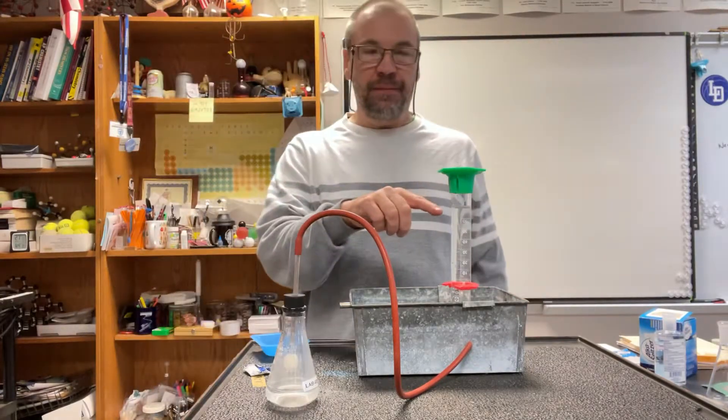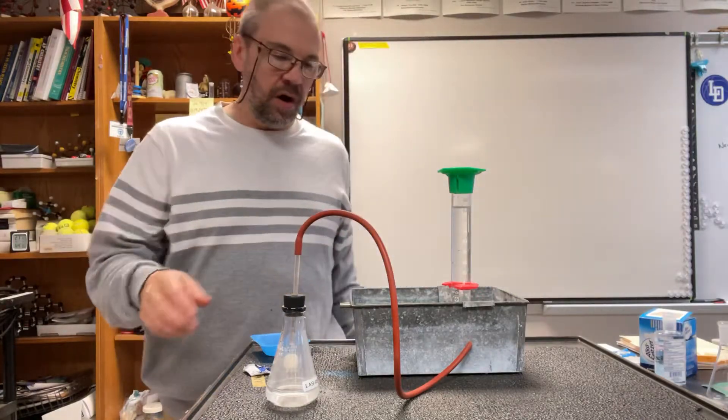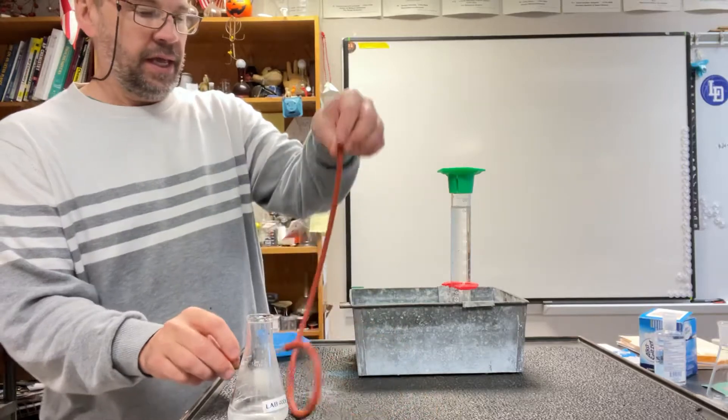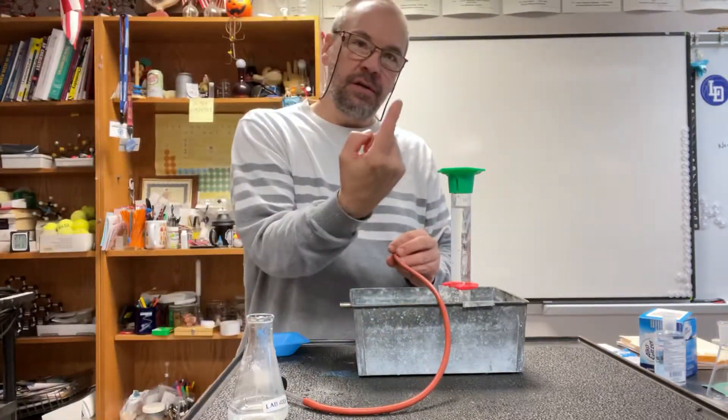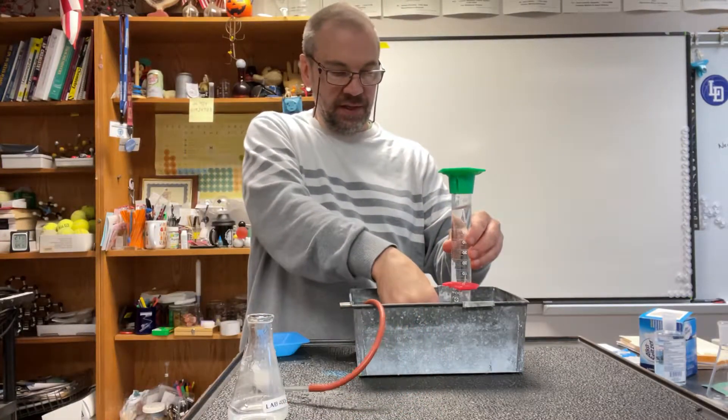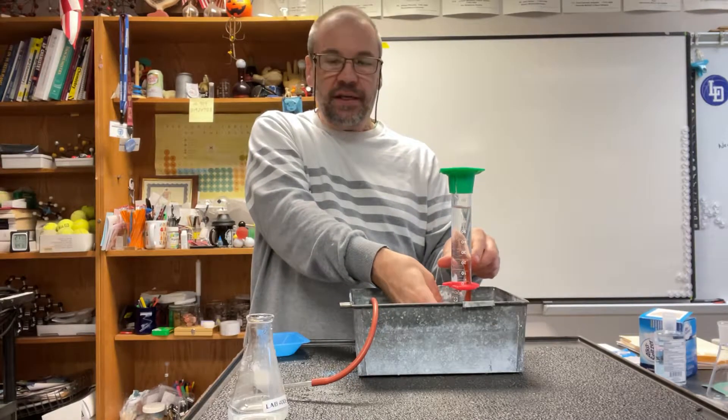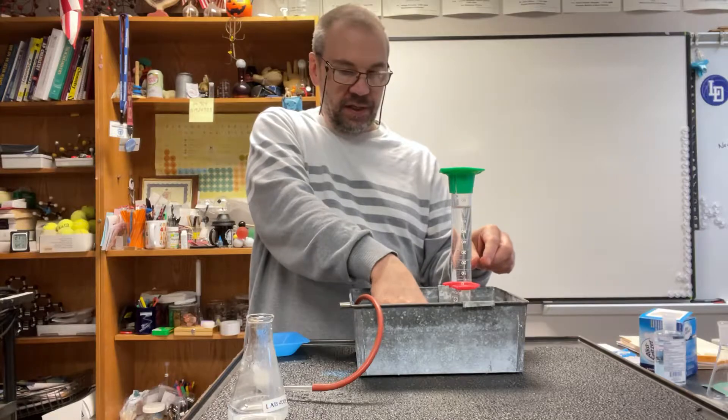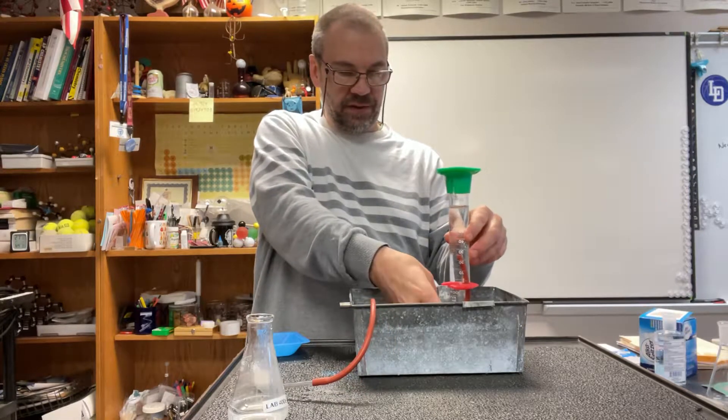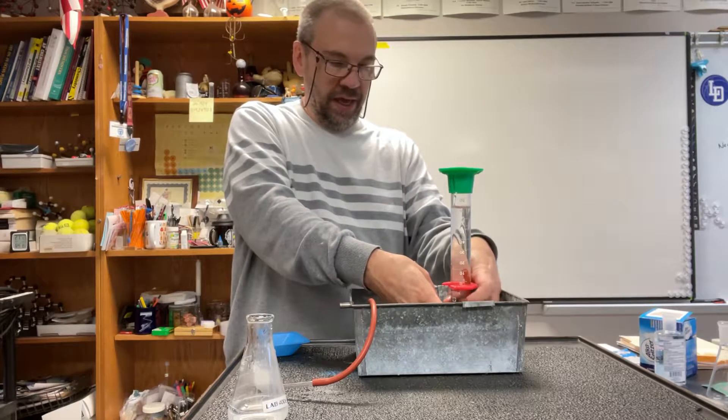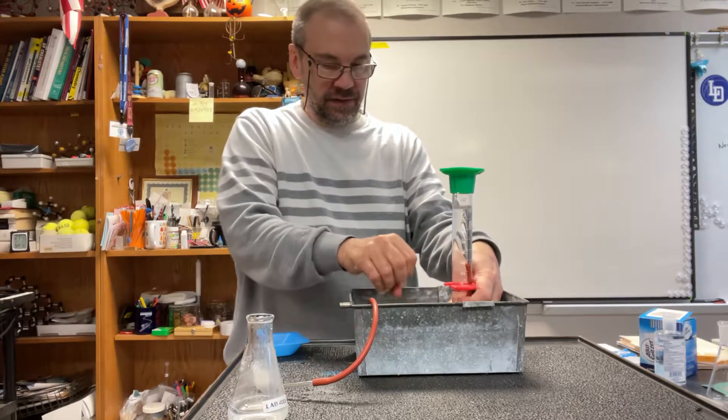All right, so what I'm going to do now is take my tubing and put it under the centerpiece, so the tubing is in the graduated cylinder. Again, you need to try this a couple of times because there is definitely a technique to it.